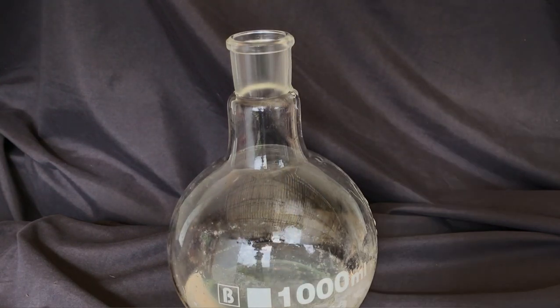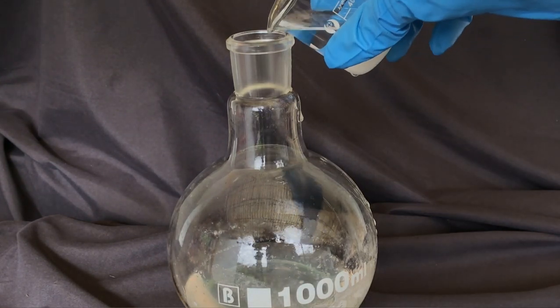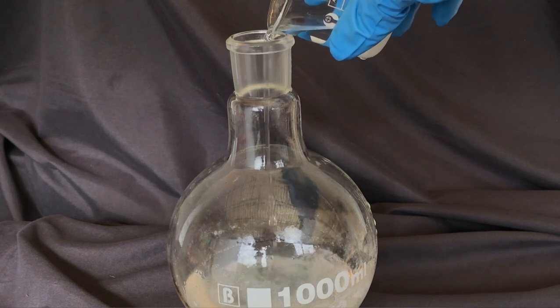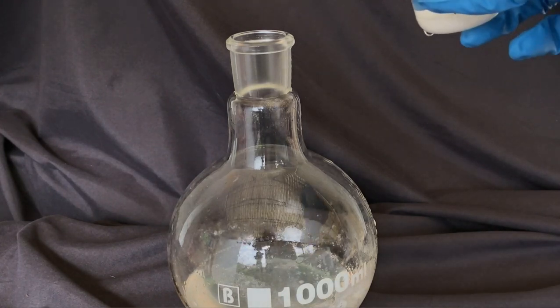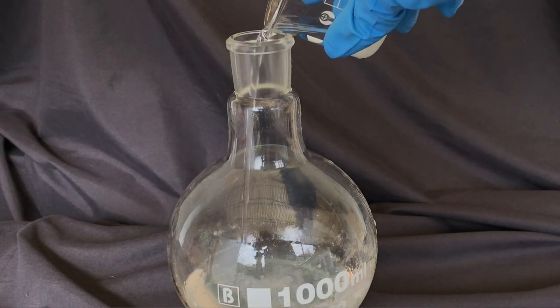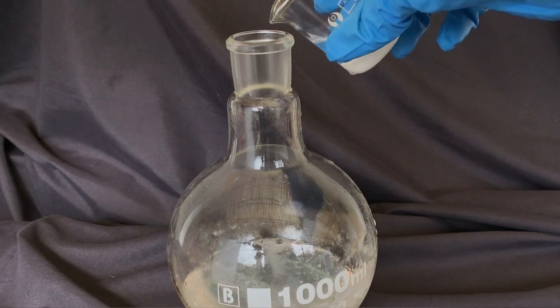Adding water, say even sodium carbonate, to an acid is always a bad idea, yet I didn't have any other solution. We simply went slow until everything was neutralized and it was occasionally checked with pH strip.